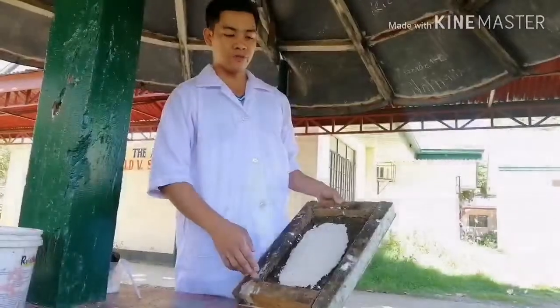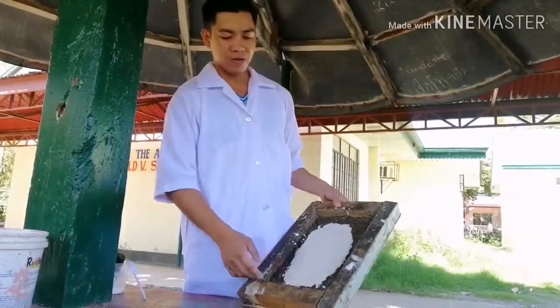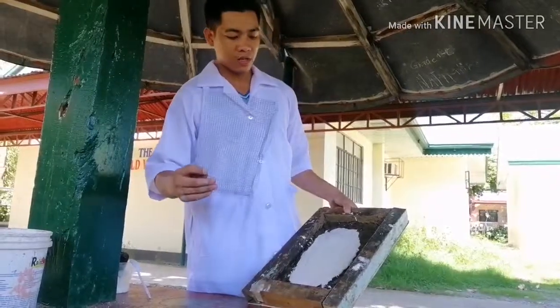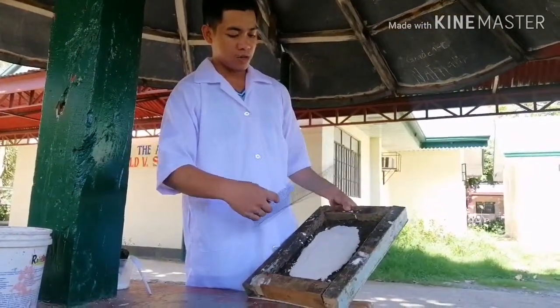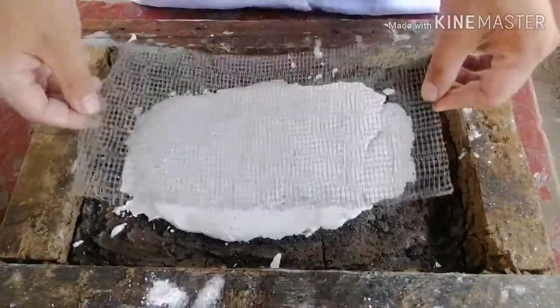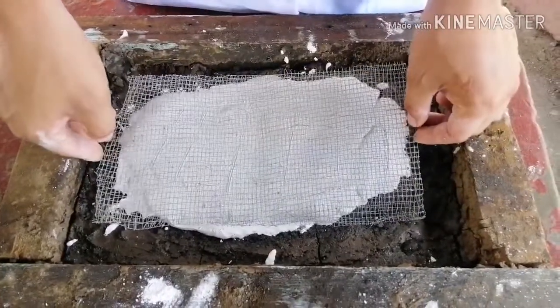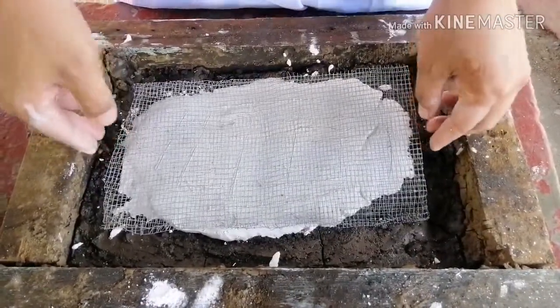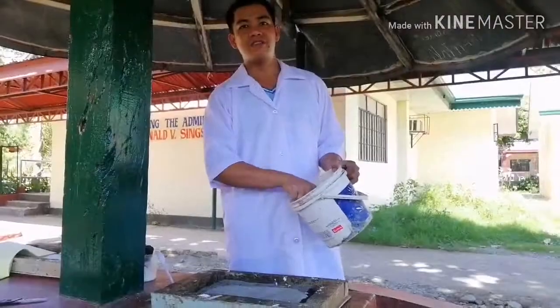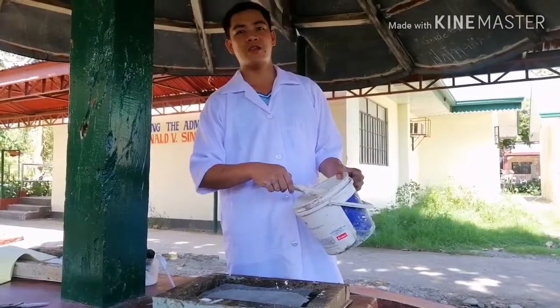Now that the first layer is dried, put the screen on top of the layer, but do not press. And now we are ready to apply the second coating.